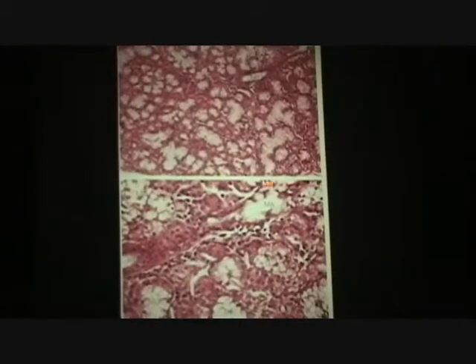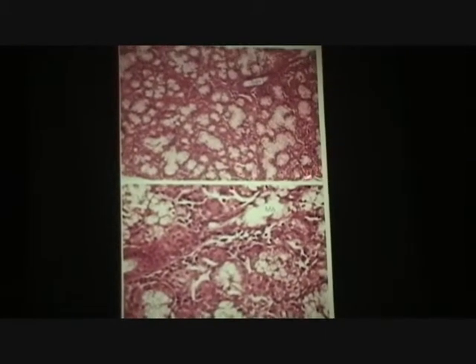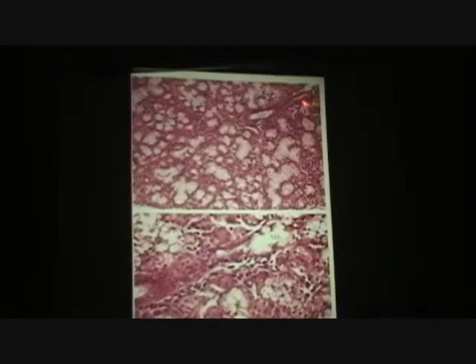Then I mentioned when we went through this before, that's the toughest call you would ever have to make. But it's still not that hard. Which salivary tissue, thinking about the progression, does that have to be? All serous? Or is that a lot of mucus? Or a tiny bit of mucus? Yeah, that's a lot of mucus.